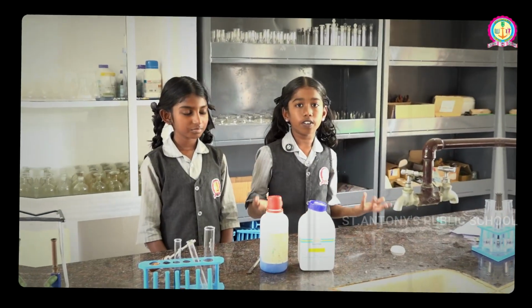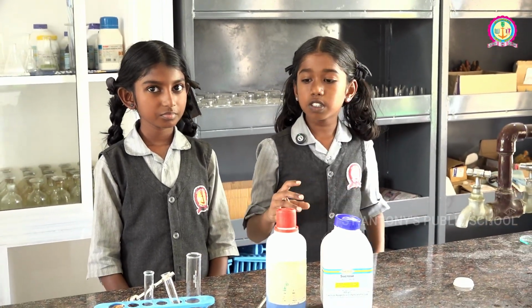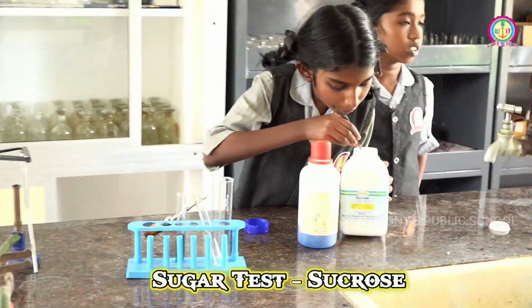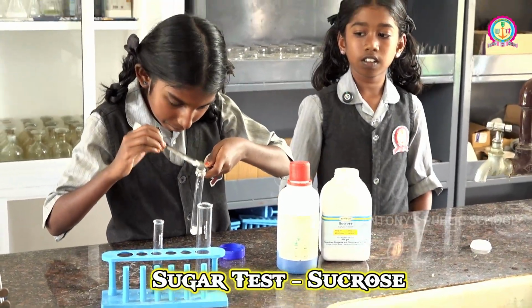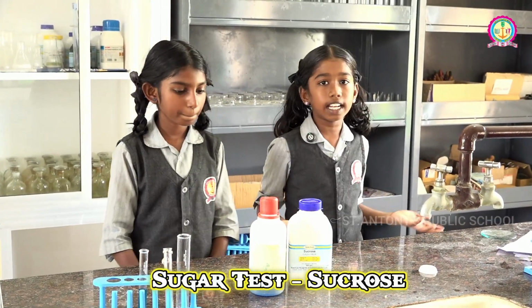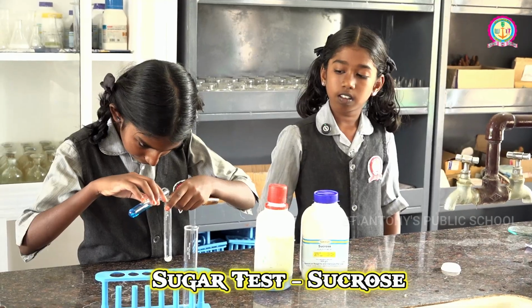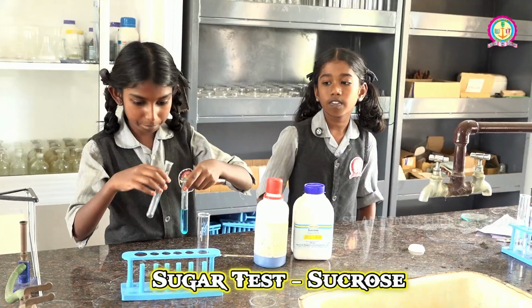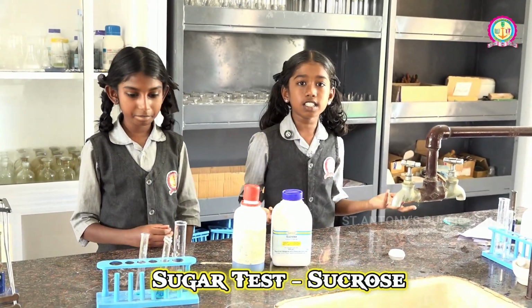Hello everyone, today we are going to test for sugar using Benedict's solution. We take the food sample in a test tube and add Benedict's solution. And we heat the test tube carefully.